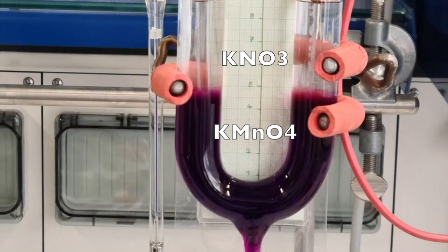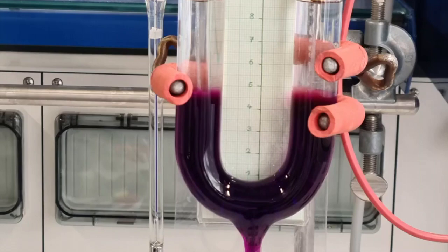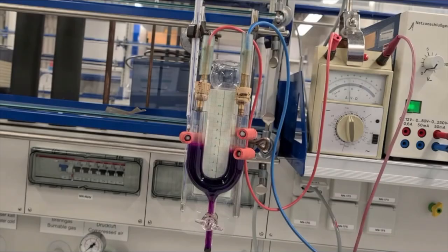Start the experiment by closing the electrical circuit and start the clock at the same time.